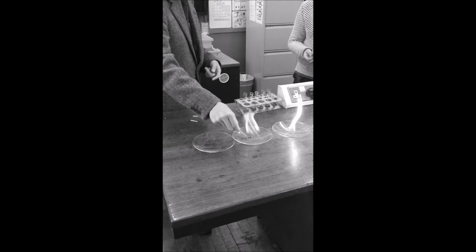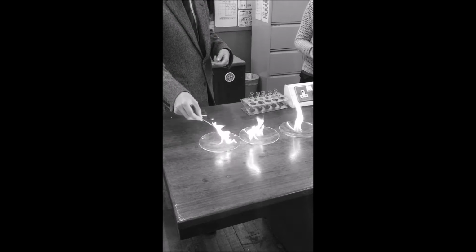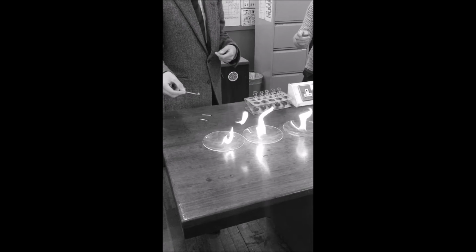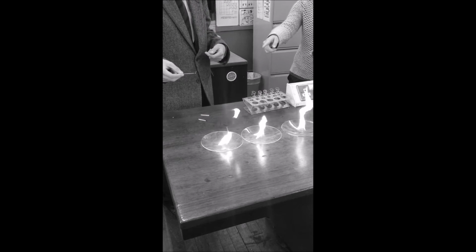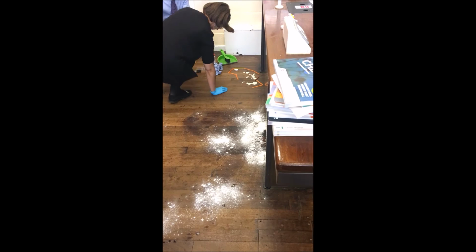And then something tragic happened that I would probably never forget. So everything was going fine, but I was being a bit mischievous and was messing around with my classmates. And then... I accidentally knocked over the whole apparatus, including the toxic mercury thermometer. Here's the broken apparatus. Thank you.